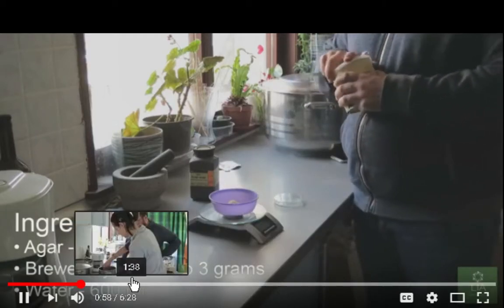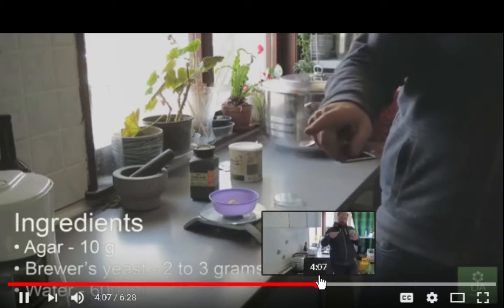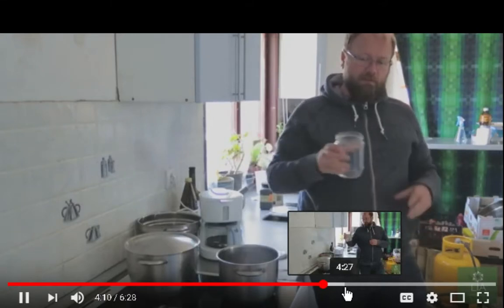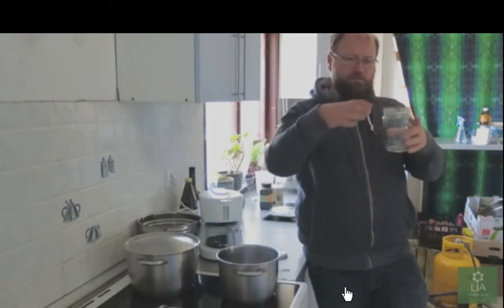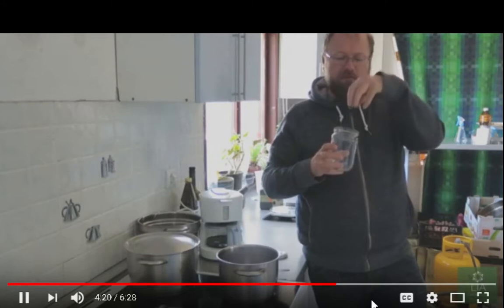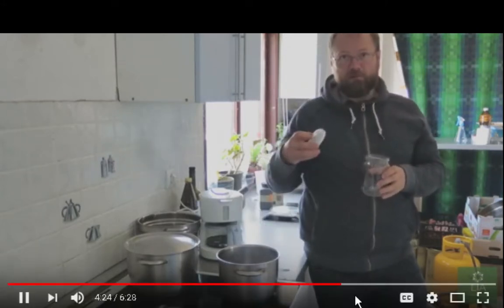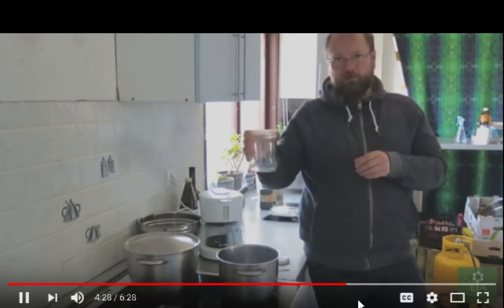But I'm not using brewer's yeast. I didn't even know what they were doing here. So let's see. Okay, let me just jump this up here. I'm just looking at different ideas about how people do this, and the importance of sterilization and not having mold and bacteria grow in your Petri dishes. And this is just a test stream to see how the stream works out.